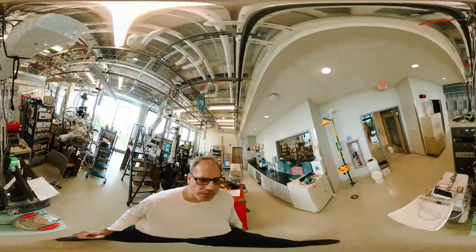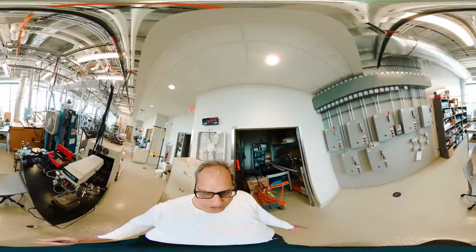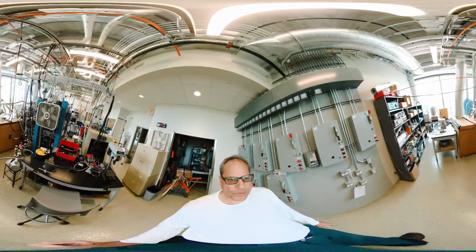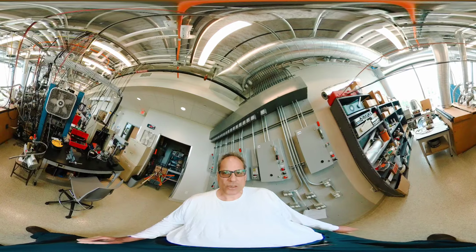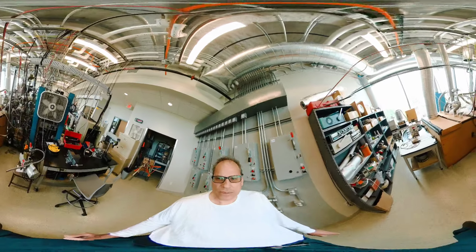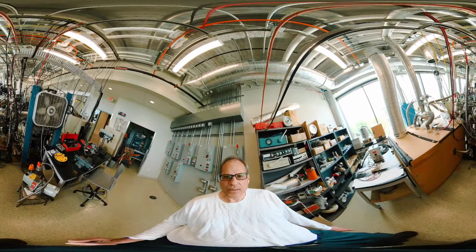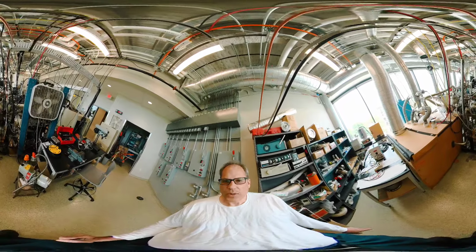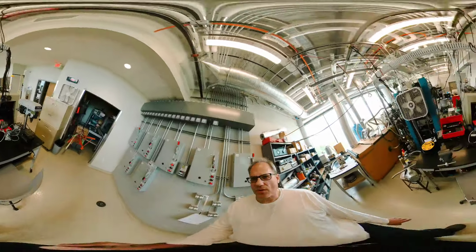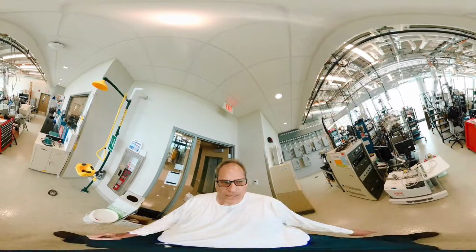We can walk around here, but we're pretty much at the end of our system. A little bit of workbench here. We try to drop down the noise actually by putting the pumps in that box here. You can see that it's dropping somewhat the noise level in the lab. So you can see the back side with the pumps, and there is a doser also mounted directly in front of us, a metal doser, to evaporate some nano-sized metal clusters on the samples. That's how an industrial catalyst usually looks like. It has a substrate and metal particles embedded on the substrate.